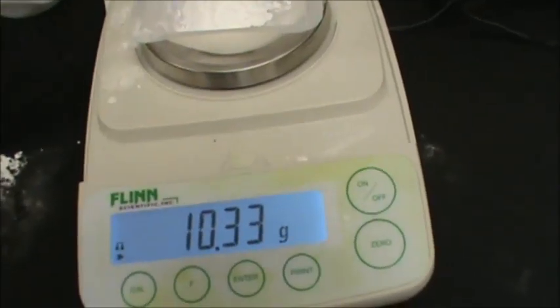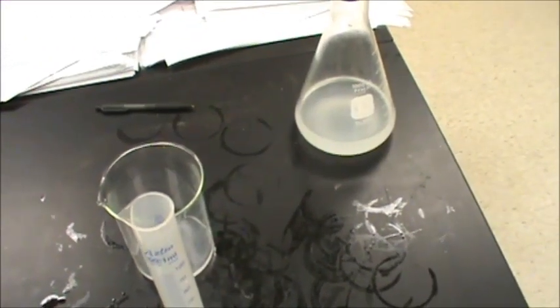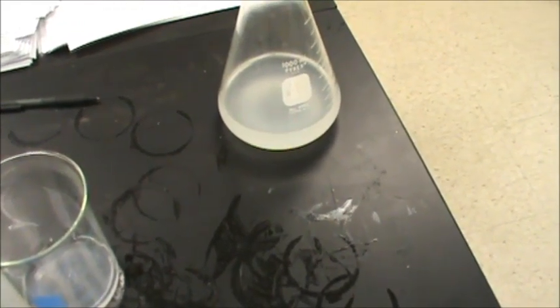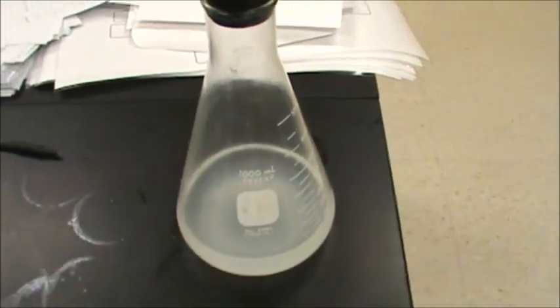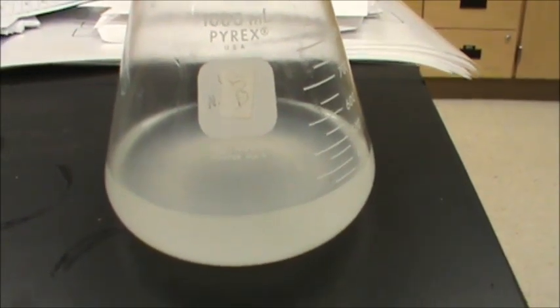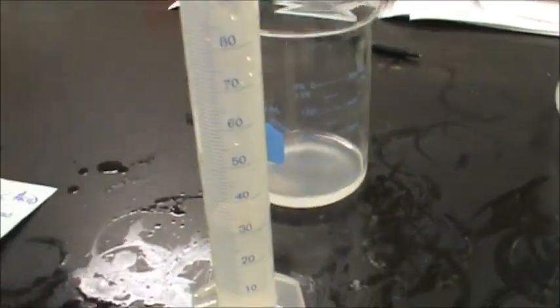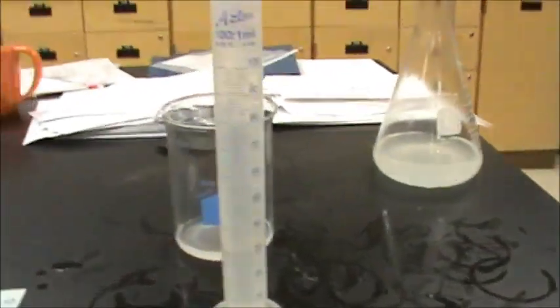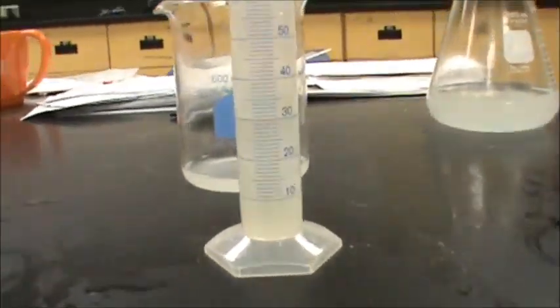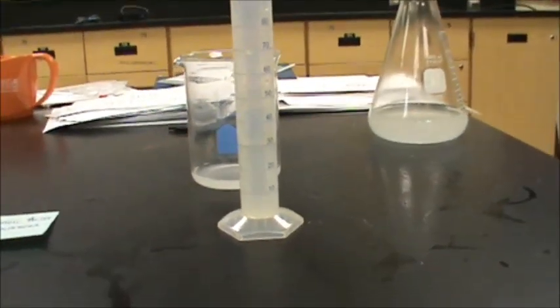Next, get the citric acid. Citric acid has a cloudy appearance — make note of that as your initial observation before the reaction. I measured out a certain quantity in my graduated cylinder because I needed 30 milliliters. I got a pretty good estimate of 30 milliliters, maybe a little short, but that's okay. So I've got my citric acid and my baking soda and I'm ready to do the reaction.